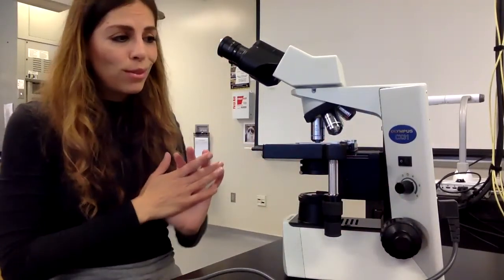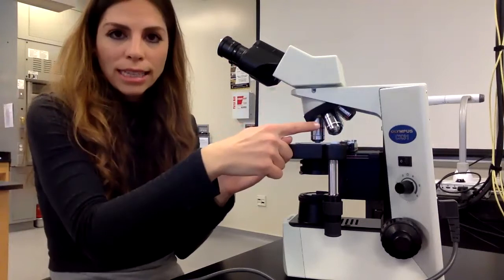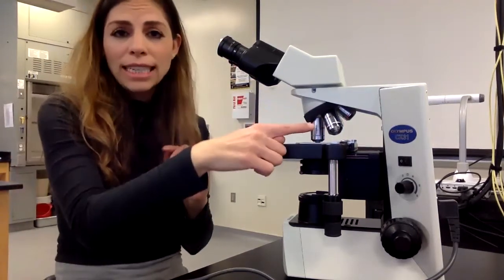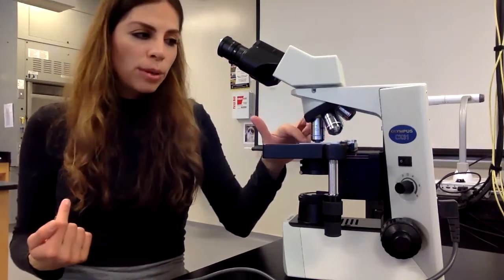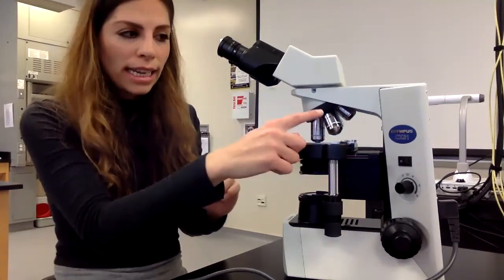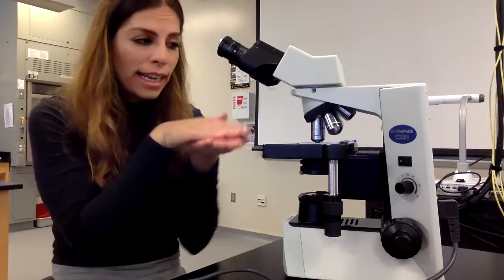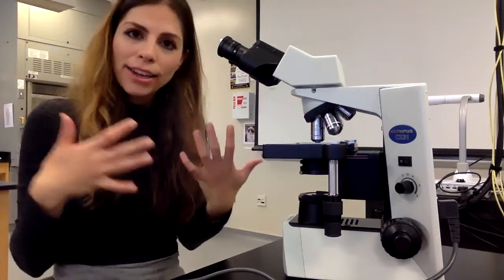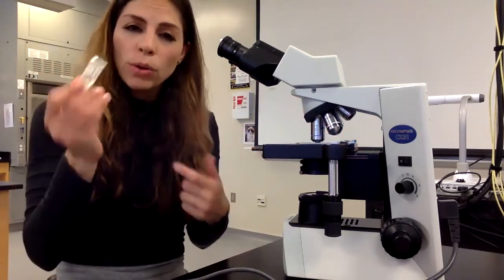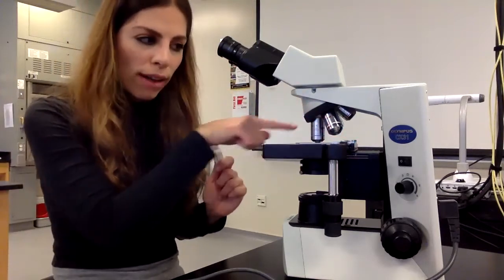The next thing I want to do is go to the highest magnification, which on the light microscope is 100x magnification. For 100x magnification, we have to do something called oil immersion, meaning we have to put oil on our slide. The reason why you have to put oil on your slide when you go to the 100x objective lens is that the objective lens gets so close to your slide that light scatters everywhere. And when we put oil, we focus light so that we can get higher and better resolution. We only do oil immersion when we're using the 100x objective lens. We don't have to do it with the other ones.